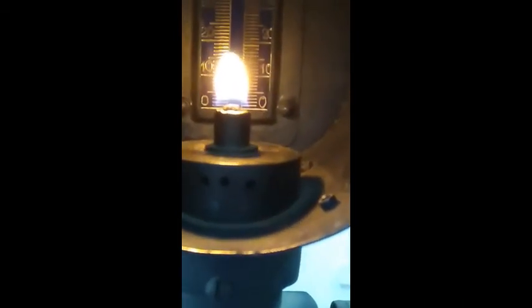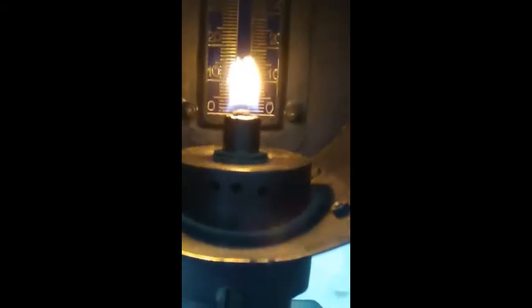For example, in this case, the scale reads 10 mm initially. We adjust our position so that we see only the flame and not its mirror image. At this position, it reads up to somewhere around 18 mm. That is how we eliminate the parallax error when taking the smoke point reading.